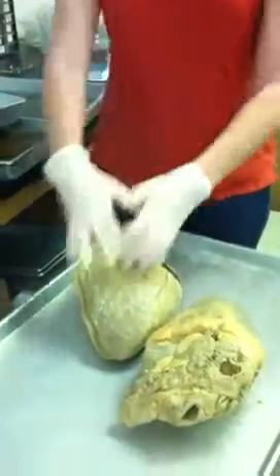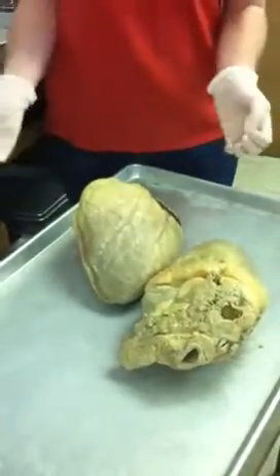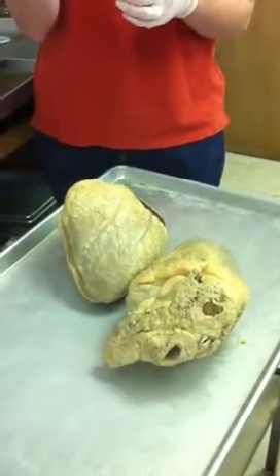So here's the heart, apex, base. The pericardial sac would be surrounding it, but we removed it. Do you remember on the brain when we talked about the pia mater and it made that shiny sheen on the cortex of the brain? Again, on the heart we have a shiny surface, and that's called the epicardium. Epi, on top of; cardium, heart. So that's what all this is.